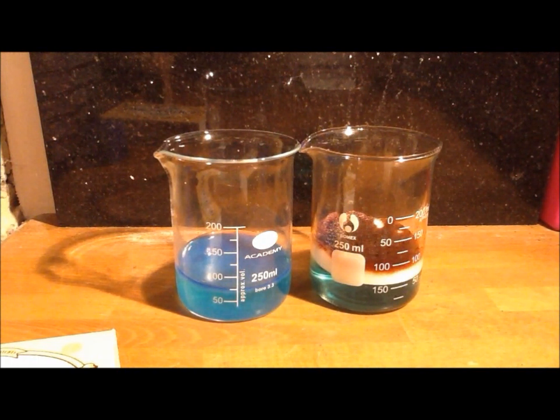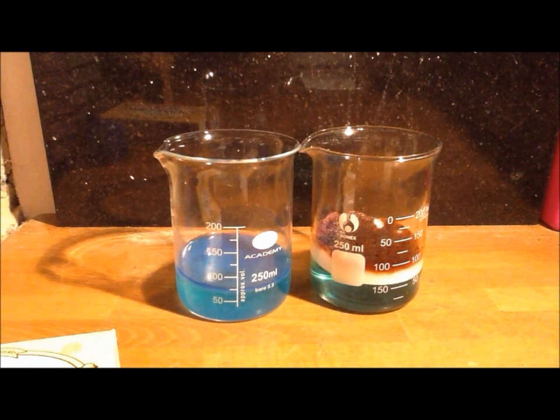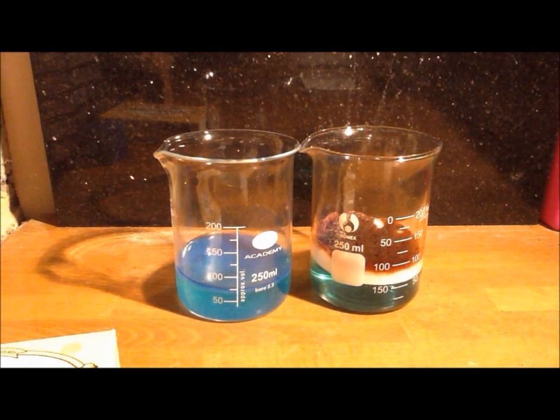If you have potassium permanganate and sodium hypochlorite, no reaction will take place. So you will be able to see whether it's a chlorine based bleaching agent or not.